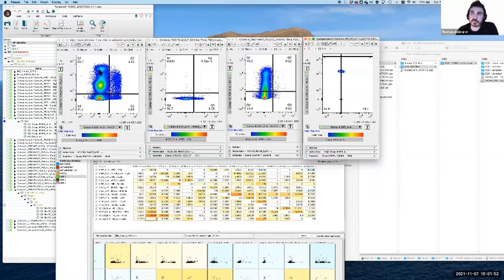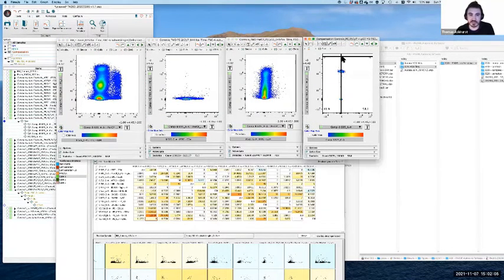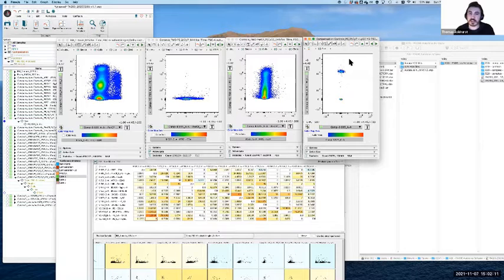Or in this case, I could be pretty safe using some cells because I'll have that full range captured. So that's very important. That was an overcompensation event that we came across, and we used the FMO controls and the single stain to give us an idea about how we may go about correcting it. Like I said, correction is not the first point of call in terms of the data. What we want to do is review our practices and how we can improve them.